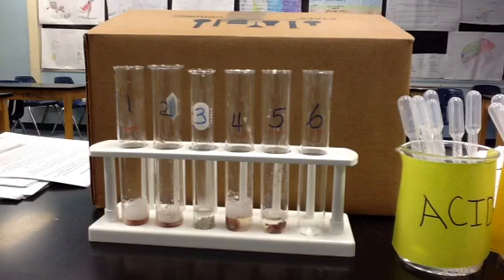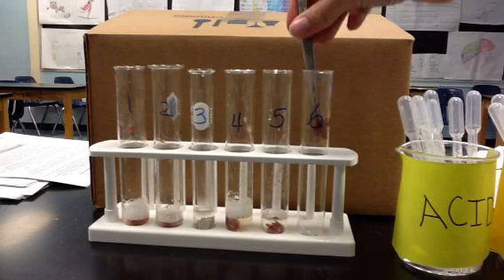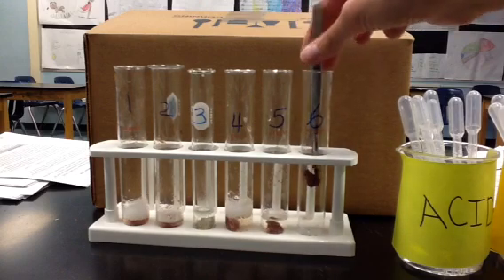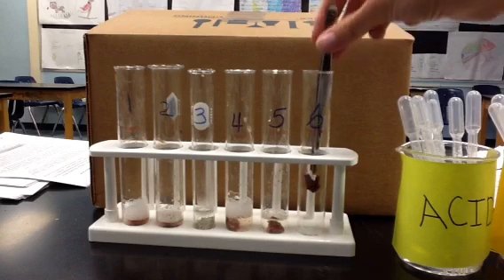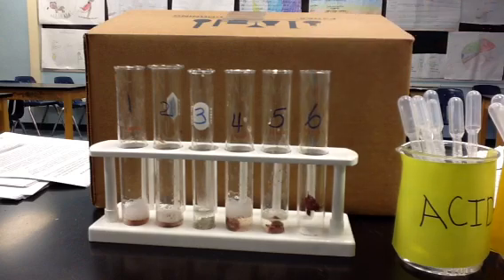Now, we're evaluating pH, and we evaluated the neutral pH, and we evaluated an acid pH. So we now need to look at a pH that's a high pH value. And a high pH value would be numbers greater than 7, maxing out at 14.